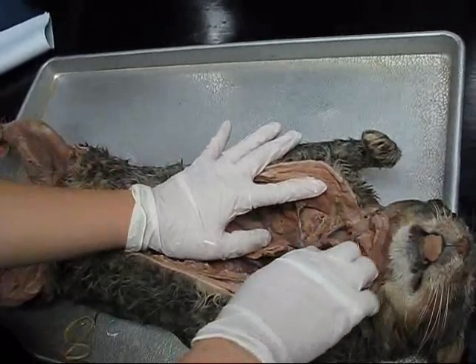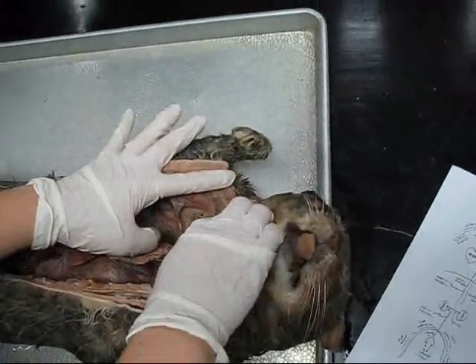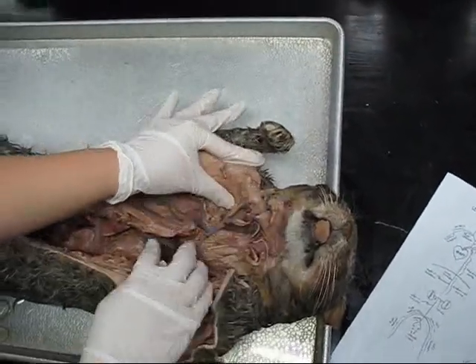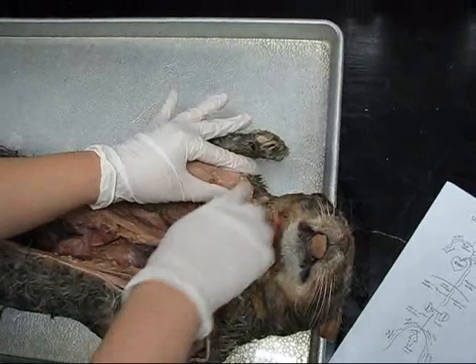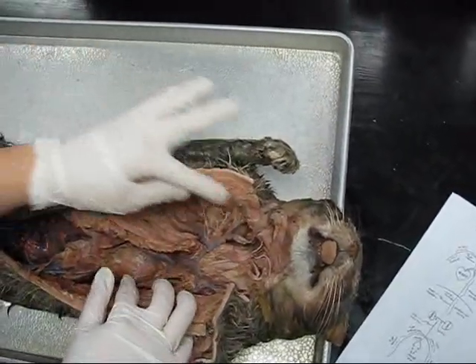Let's do the one that's off the jugular first. So the jugular is coming up here through the neck — that's the upper one. And coming off the jugular here is the transverse scapular. You can see right here, and that's going to go back around to the shoulder — the scapula, the shoulder.